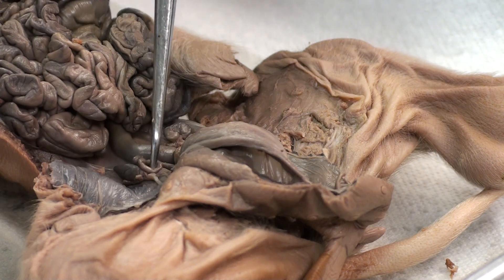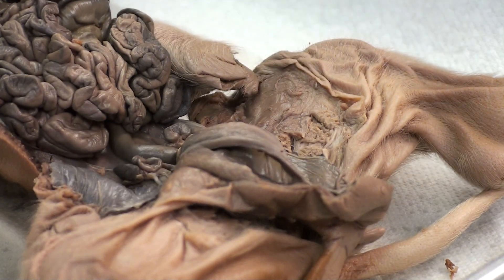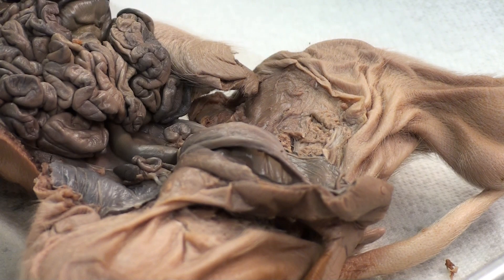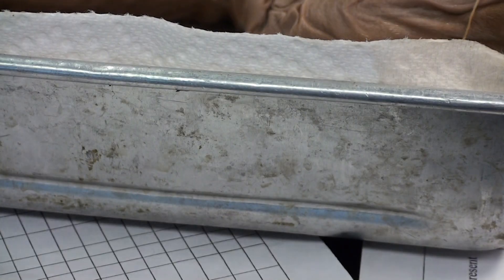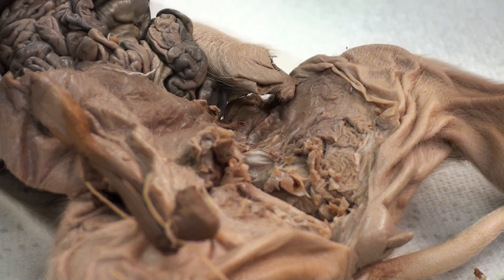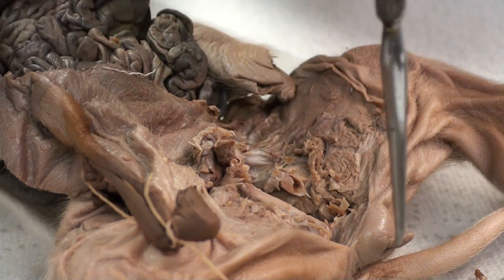And this right here is the fallopian tube, which leads into the uterus. And here is the uterus.